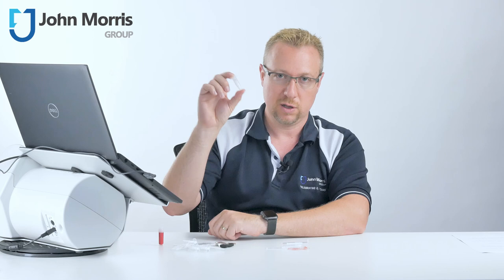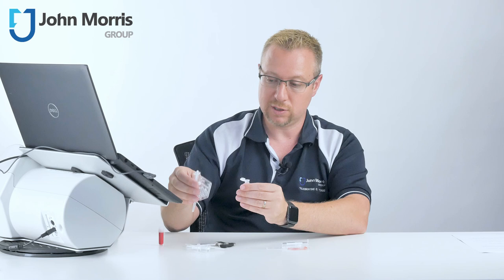So in order to do that, what I've got here is a sample of calibration beads. So shaking them up to make sure we've got the beads in suspension, I'm going to now introduce our cassette and push down.